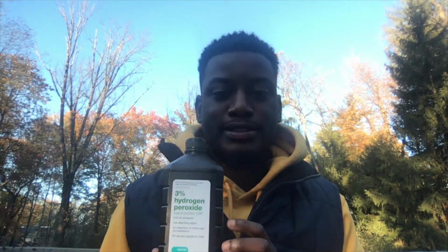So we are going to be using a few basic tools for this experiment. First, I do have myself some hydrogen peroxide here. I'm not sure if this will be strong enough. This is 3% peroxide, and there were recommendations in the lab to use 10%, but I couldn't find any 10% where I live. So we're going to see how the reaction does with 3%.